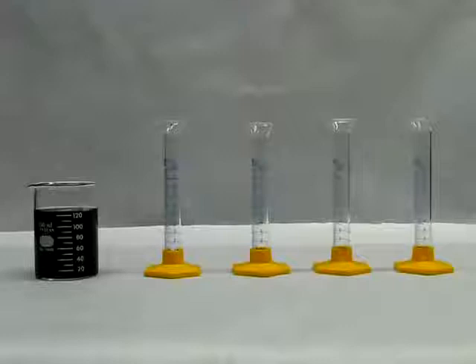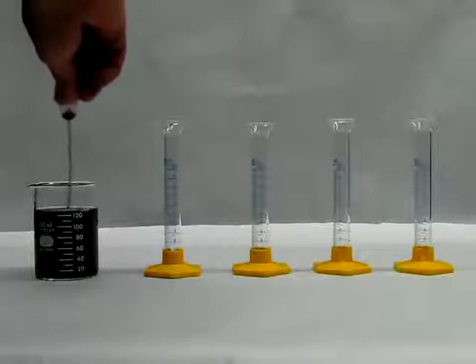If we have a color sample, as we said before, to study the dependence of percentage of transmittance with concentration, we have to prepare different solutions.